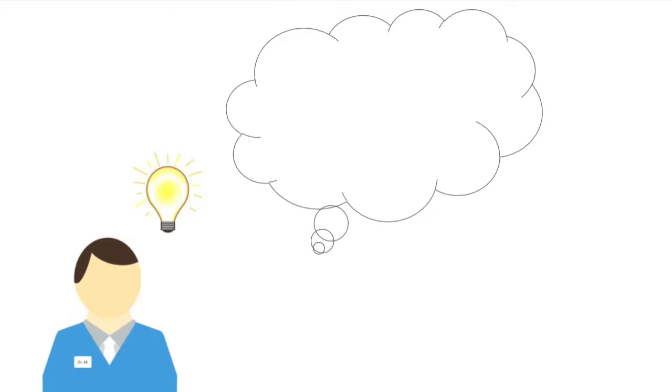Now that we've introduced Neptune as a tool to aid synthetic biologists in designing microfluidics for various experiments, let's follow an example researcher looking to do just that. Our story begins with Dr. Ali, a synthetic biologist with the simple yet exciting idea of creating a microfluidic that will help him characterize the expression of a novel genetic part when variable levels of inducer are present.